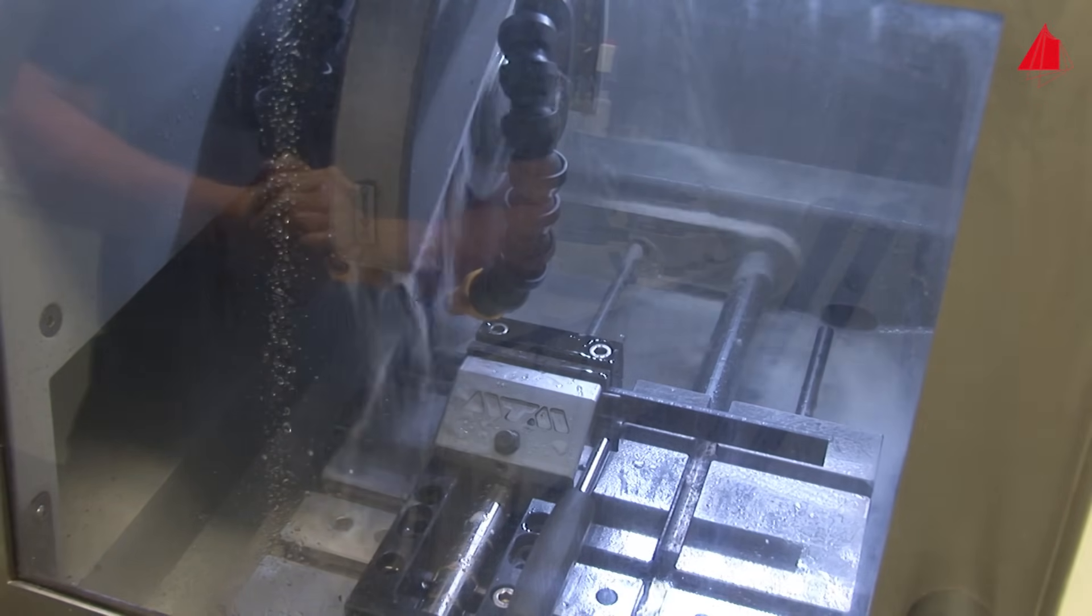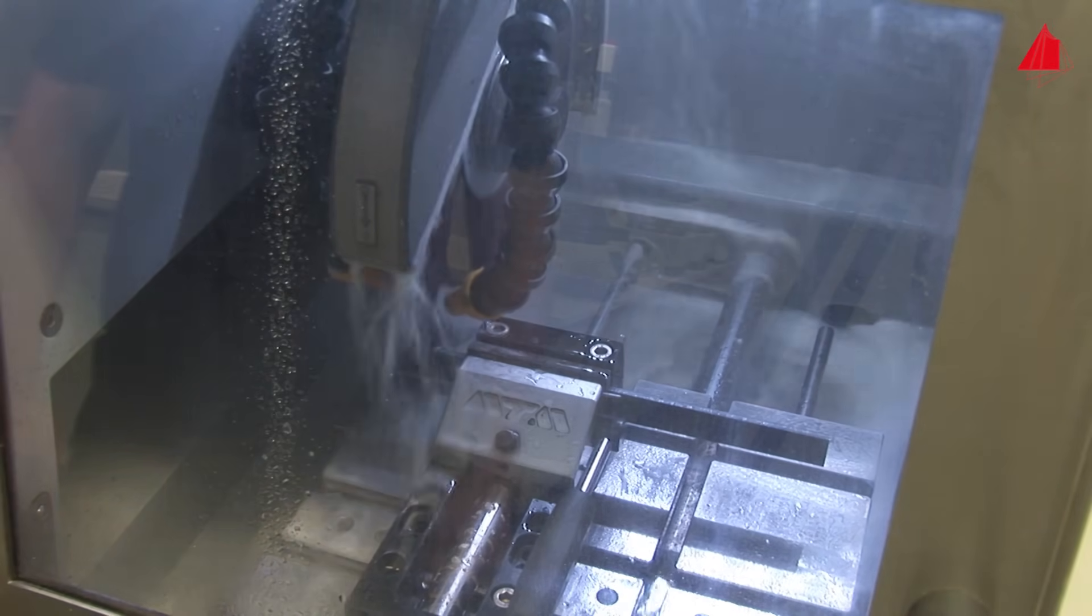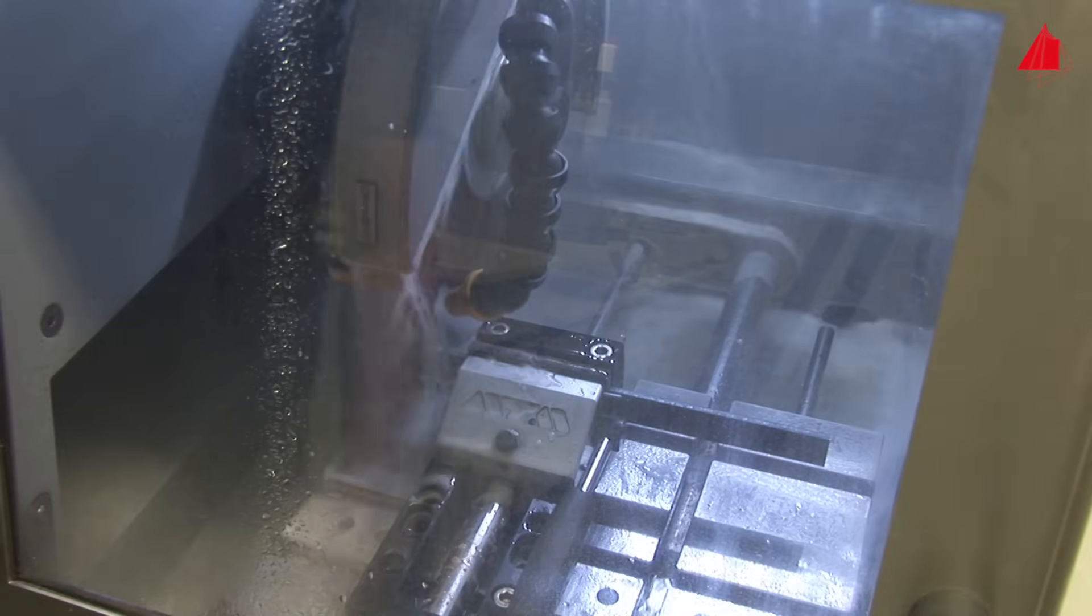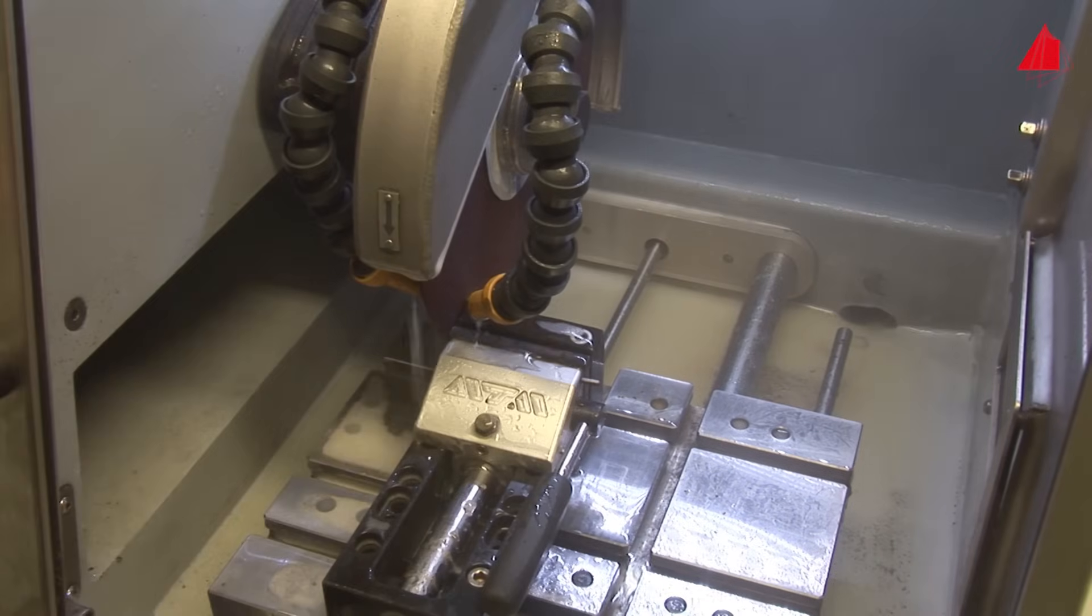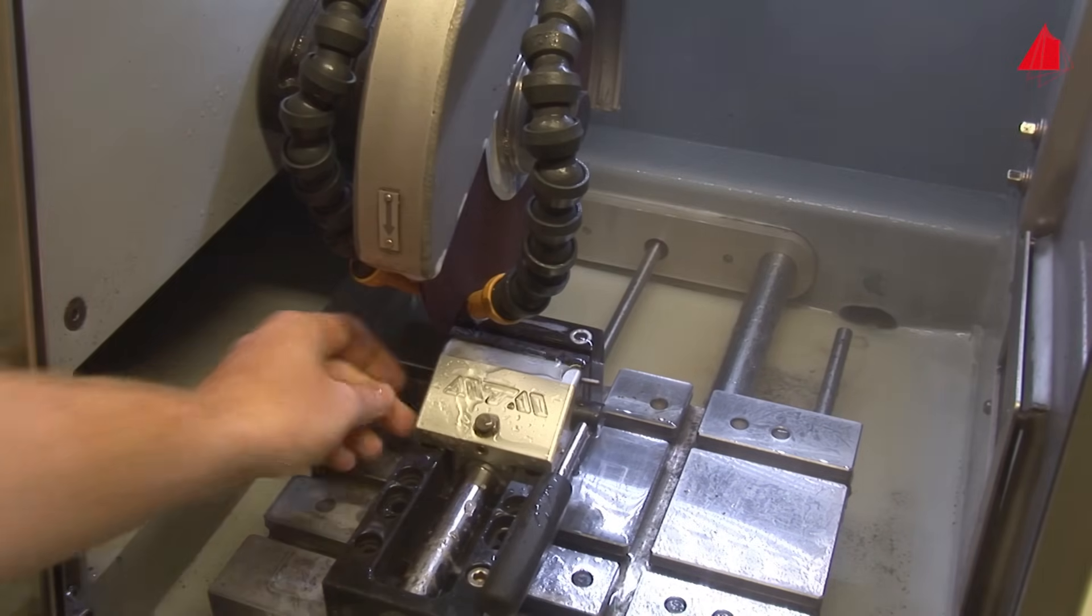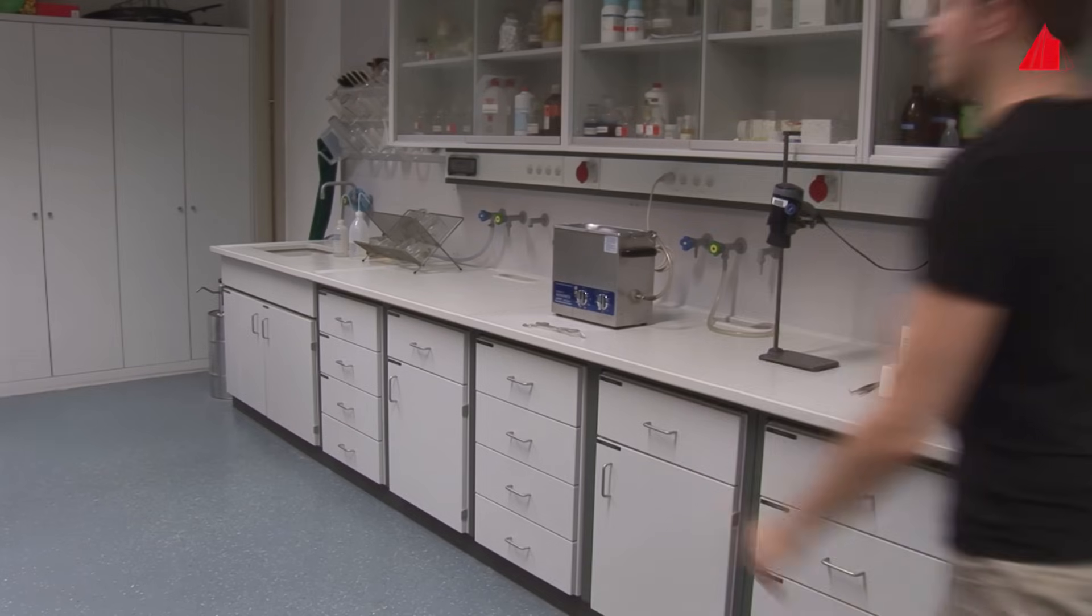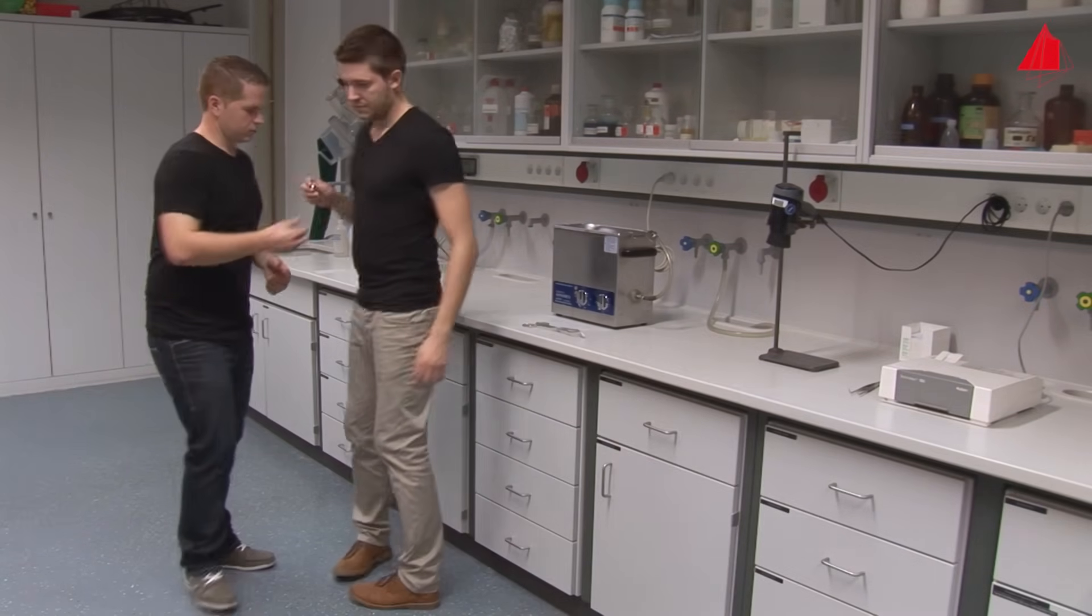Intensive water cooling and appropriate cutting parameters are important to keep the material as cool as possible. After finishing all abrasive cuts, the material tester picks up the sample and hands it over to his colleague.